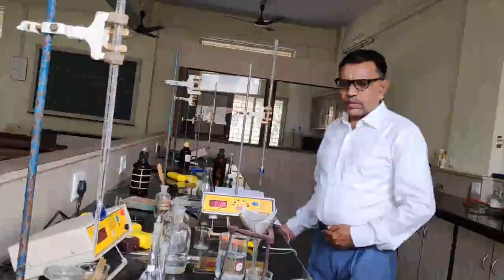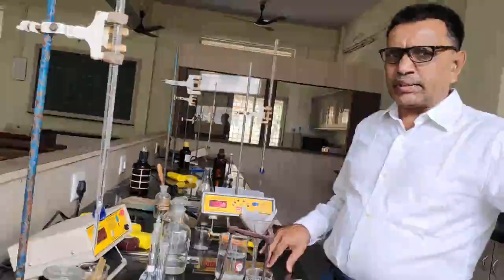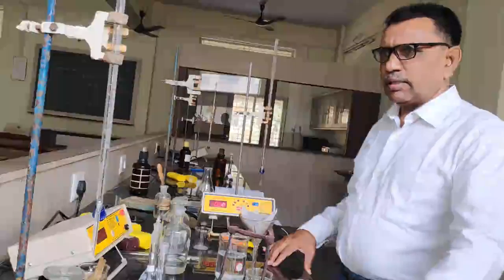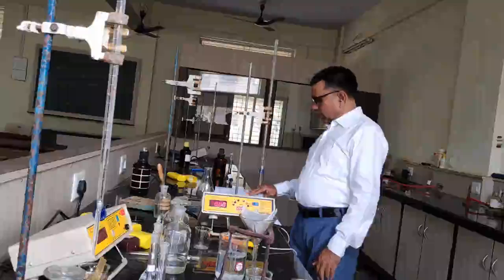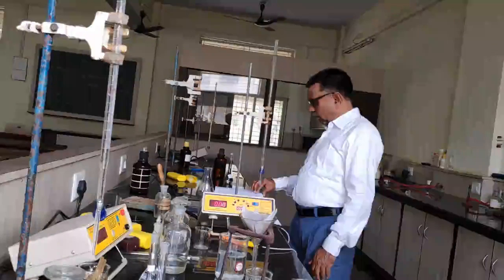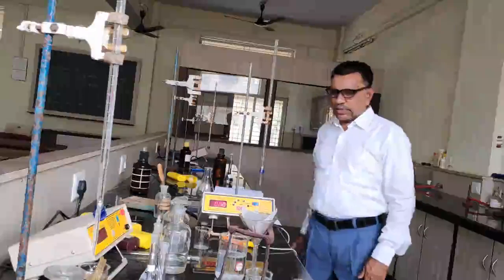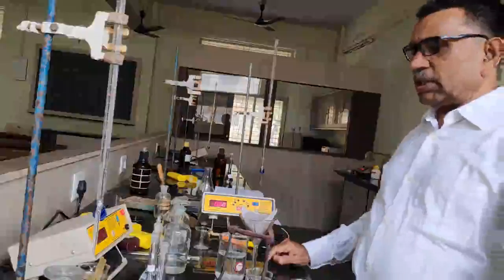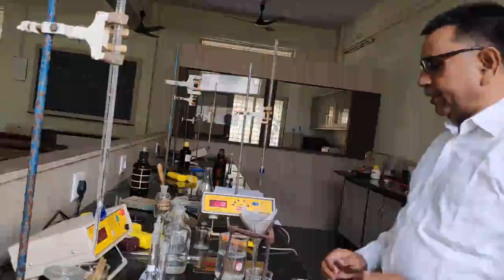In this video, I would like to perform the third conductometry experiment of the SYBSc syllabus. The experiment is to determine the dissociation constant of weak acid conductometrically. So what are the requirements for this experiment?